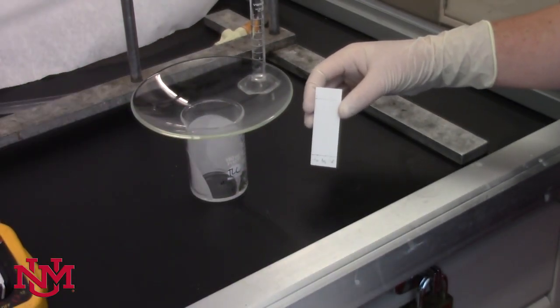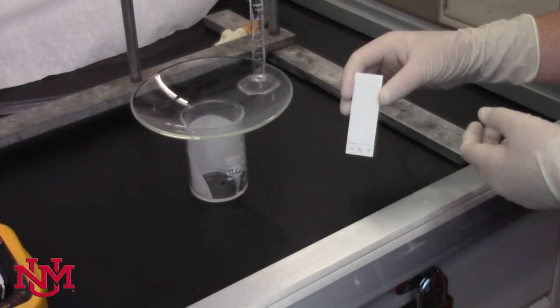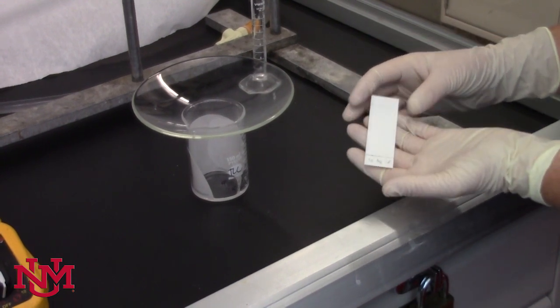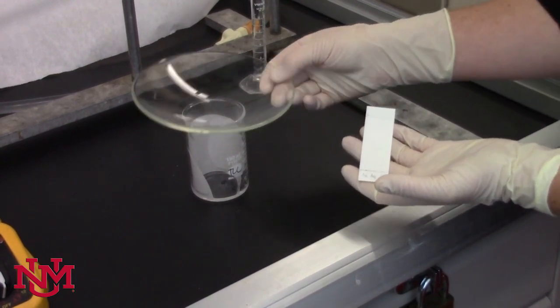To develop your TLC plate, go back to your developing chamber after it's been 10 minutes or so and remove the watch glass. Continue to hold your TLC plate by the sides.